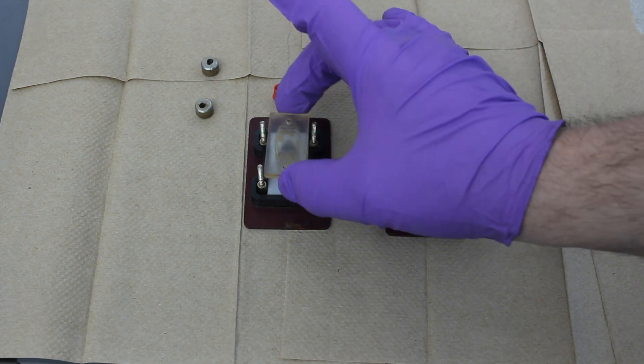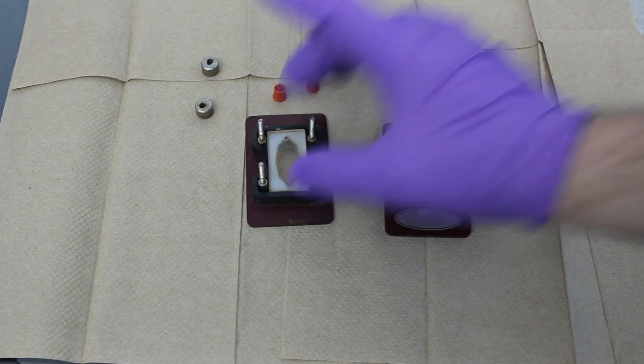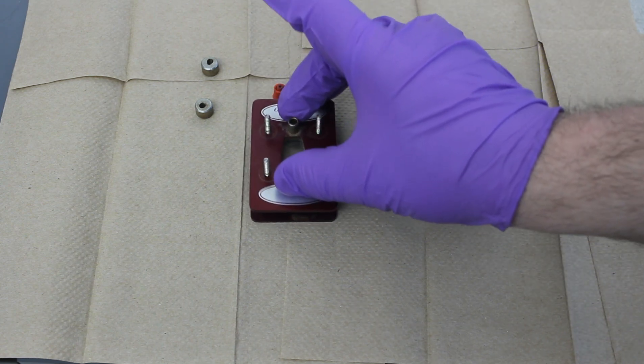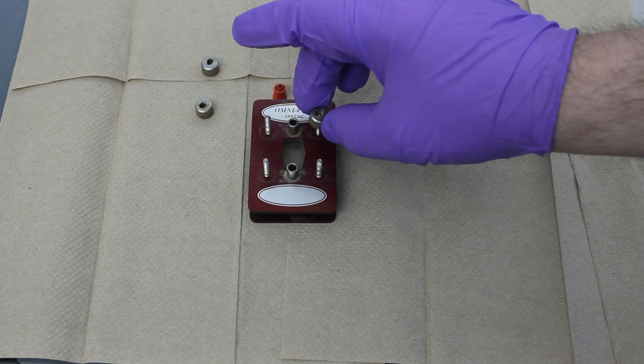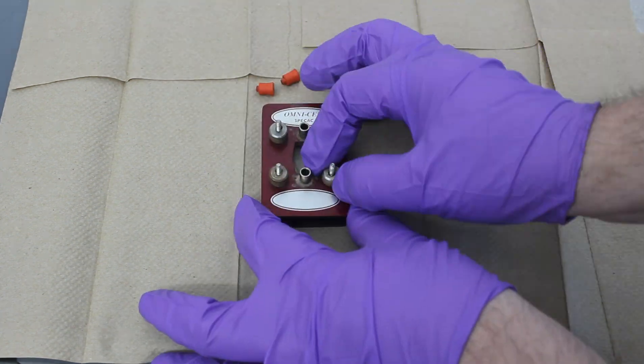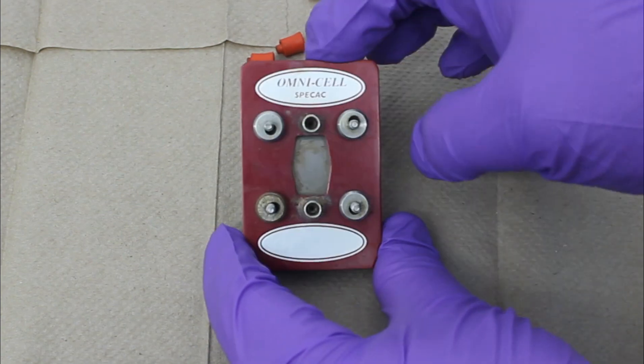So now the top plate goes back on, very carefully. And now we place this top plate on there. And then we just tighten the bolts. And there you go.